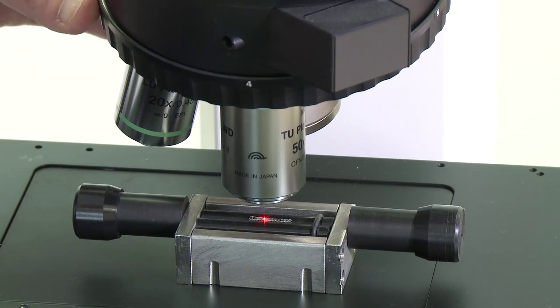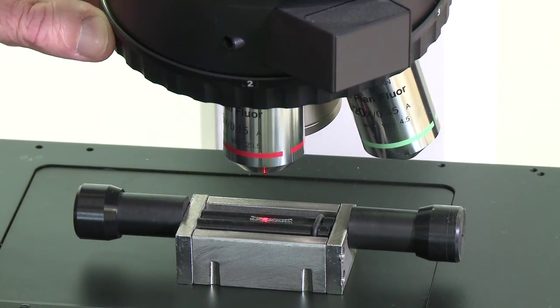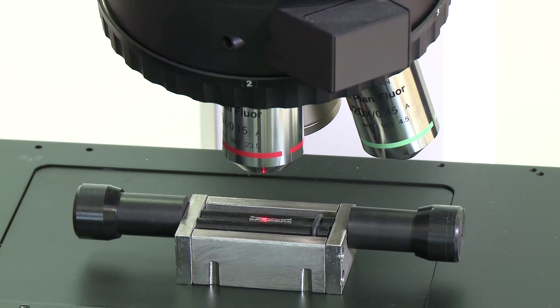We can support several different models of industrial microscope, and we can supply an n-gauge matched to a microscope of a customer's preference. At the back of the n-gauge, a single Ethernet cable connects the n-gauge to an external computer which provides the graphical user interface and the data processing capabilities which turn the raw optical data into measurements.